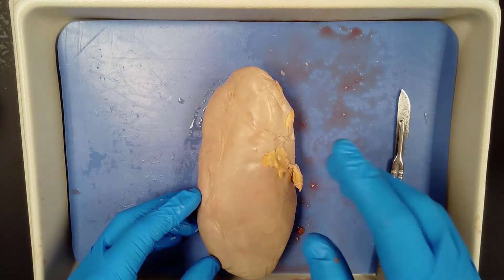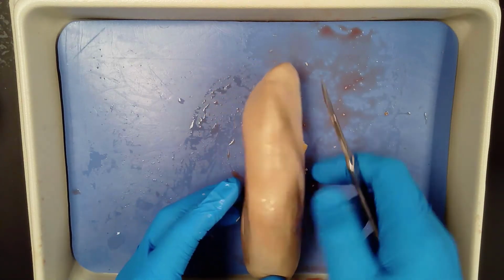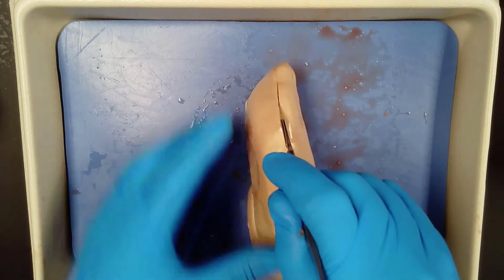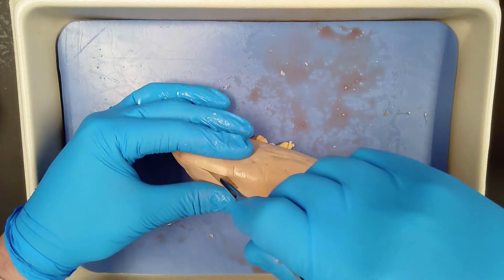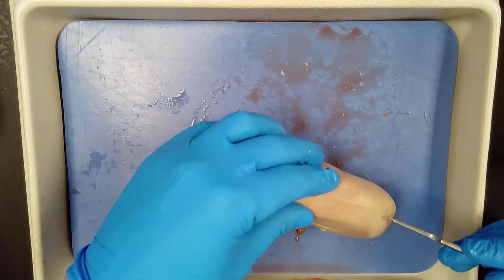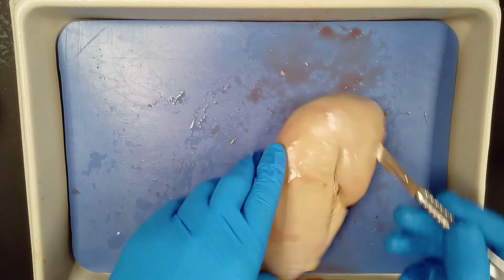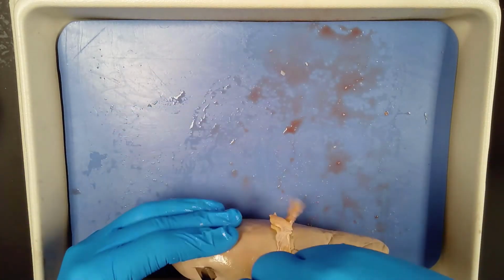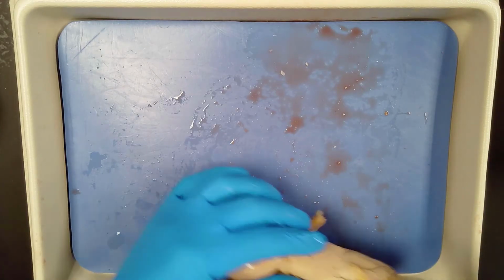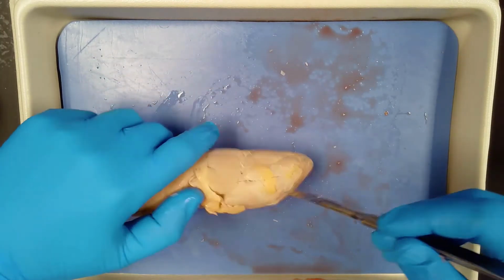Okay, so I'm going to make a frontal, or what we call a coronal cut of the kidney so that we can view all of the internal structure. So I'm going to cut across here. I'm going to be careful not to cut my fingers, to see if I can make a good enough cut. And like I said, this is pretty dense. I'm going to have to make a couple passes at it. See, I already have a cut there. So I can get it to come around.